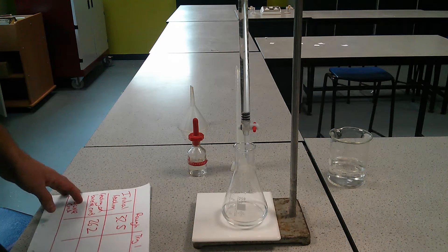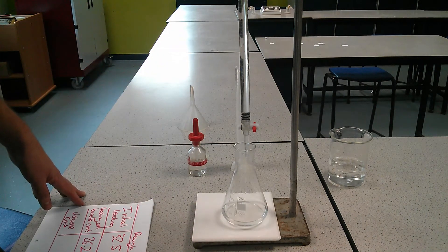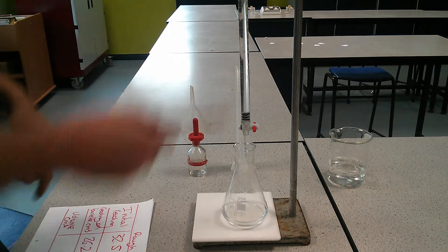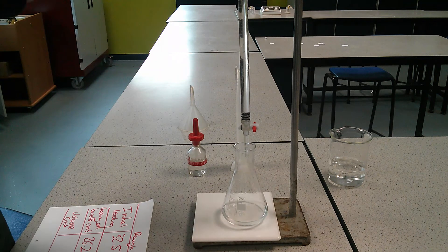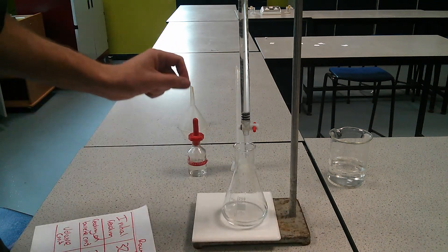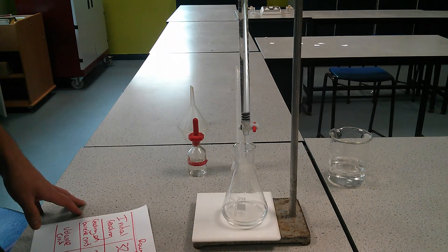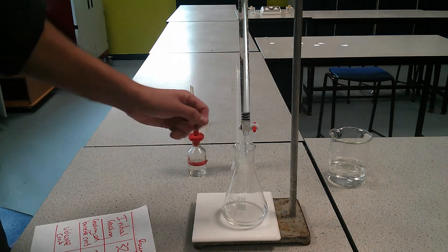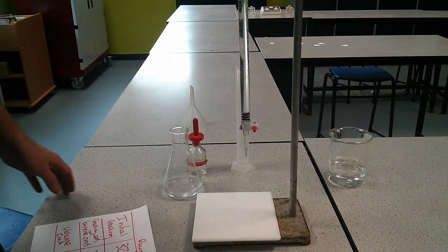What I'm then going to do is repeat it. So I measure out 25 millilitres of sodium hydroxide, refill my burette, and go down to around 20 so it's not too close. Then drop by drop — a drop at a time — add it and stir until it changes. I'm going to do that several times to get a more precise reading.